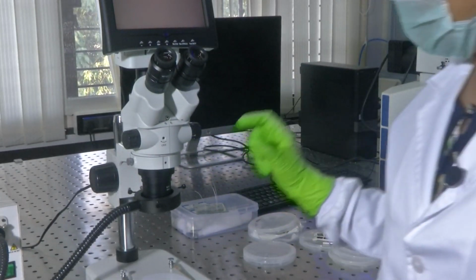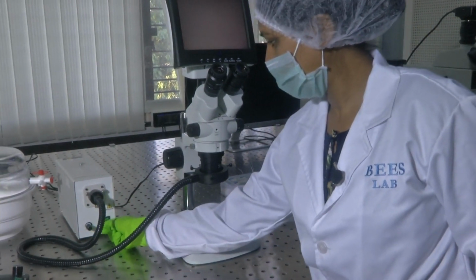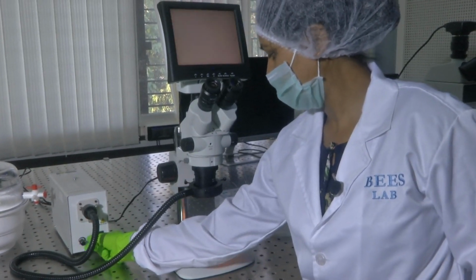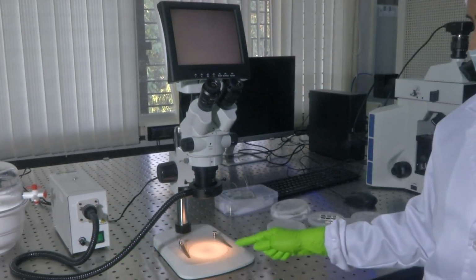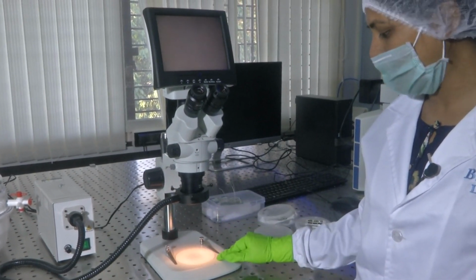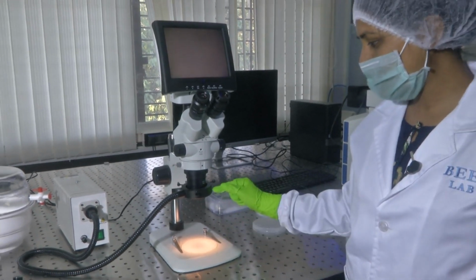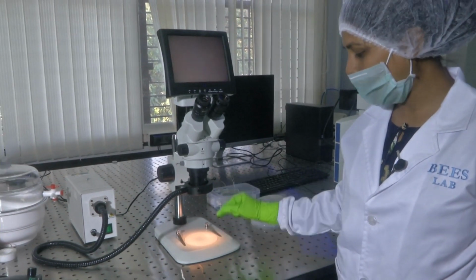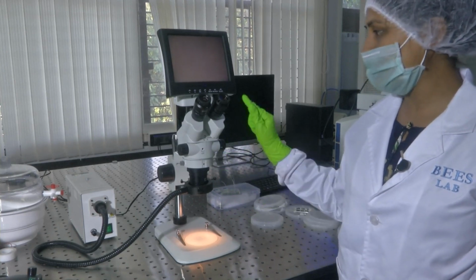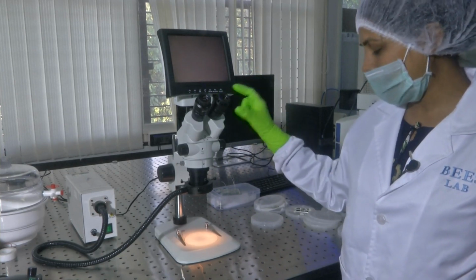So, now let me turn it on and show you. I slightly varied the light intensity and you could see the light. If I have my sample on this base, which is a sample holder, light shines through this, and what is reflected by the sample is captured and an image is formed, which you see through your display, and you could also see through the eyepiece.